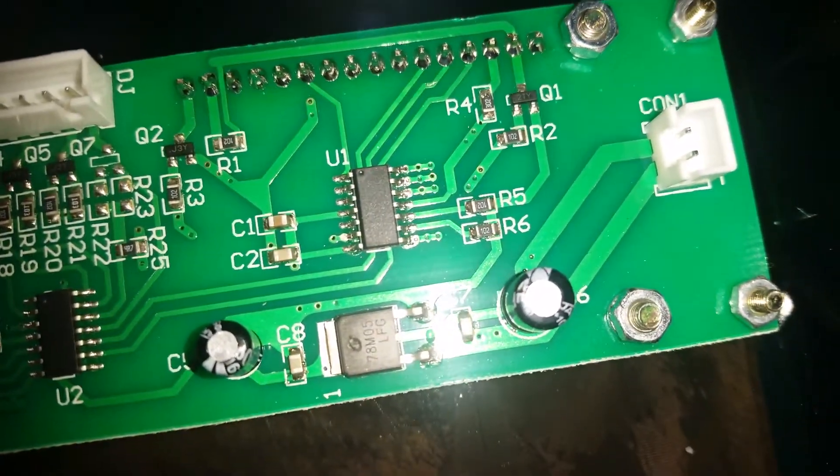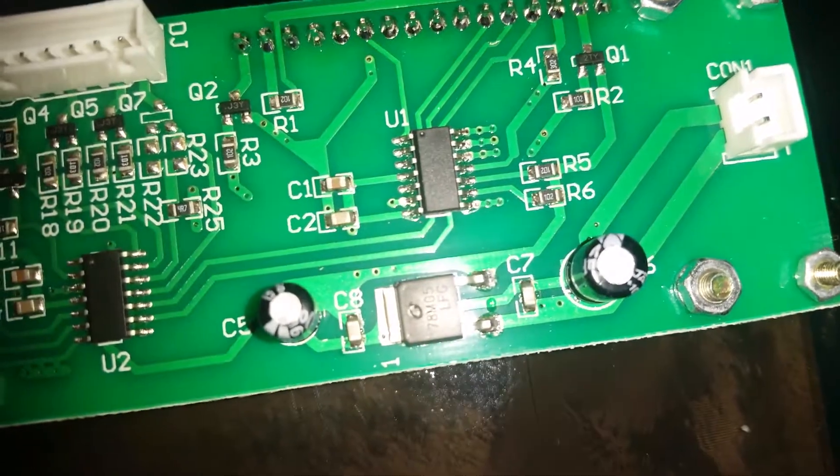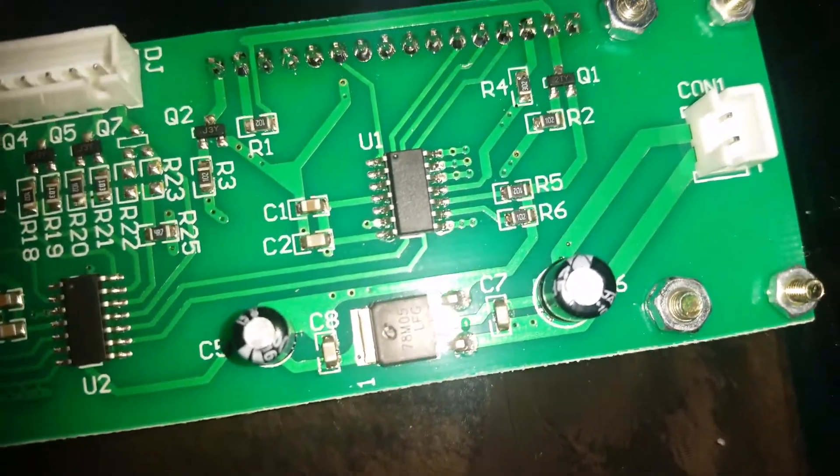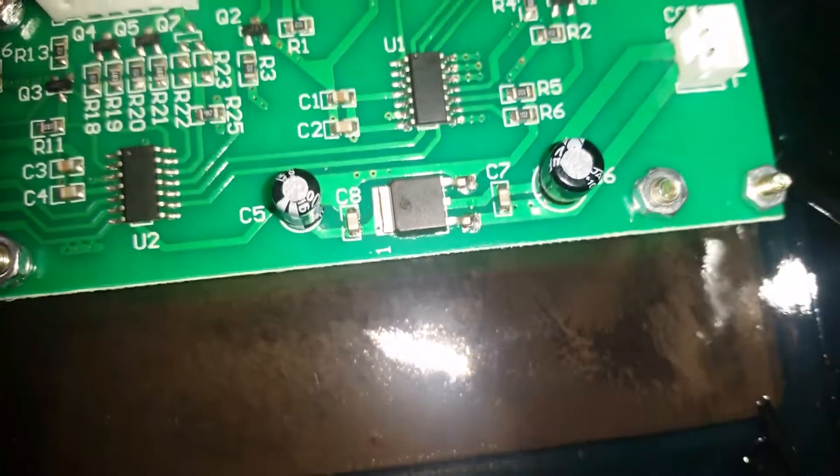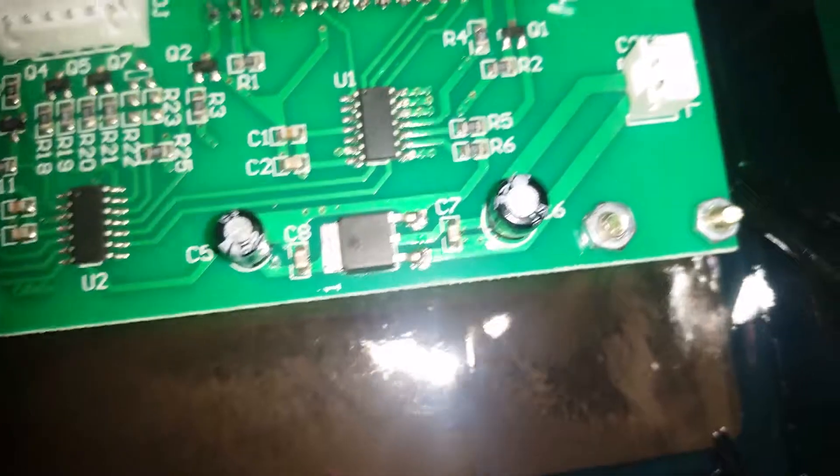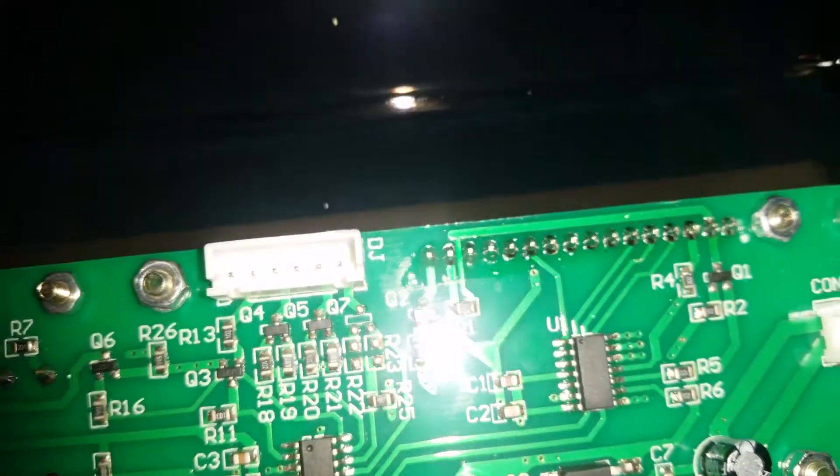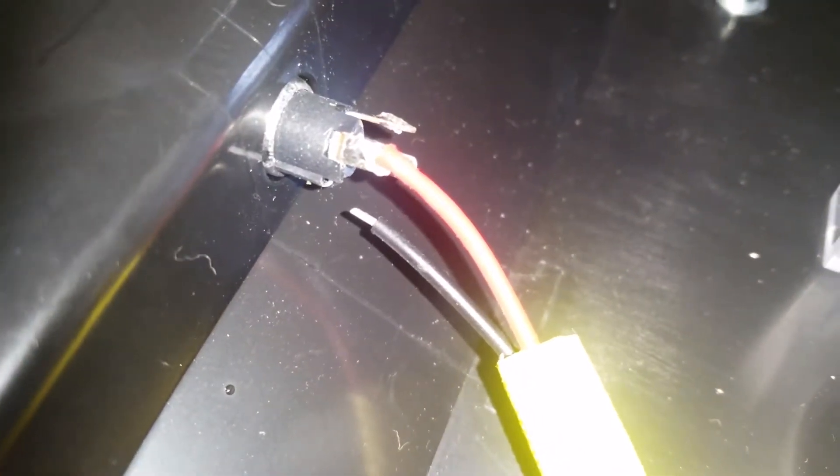I'm going to take it out of here and check these capacitors. Seems like they may not have a good connection. I don't know. It may have all just boiled down to this connection here. I don't know if you can believe that. That is quality work right here.